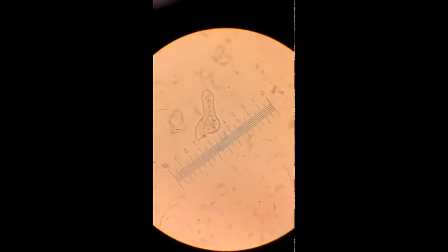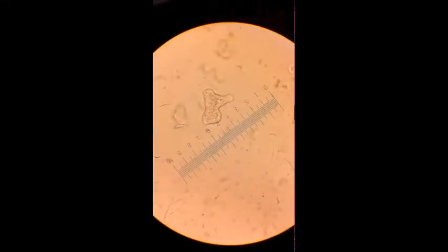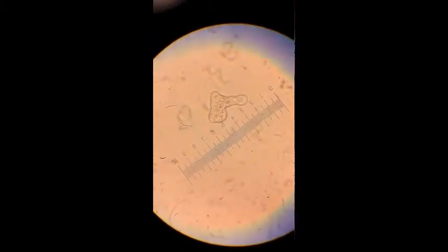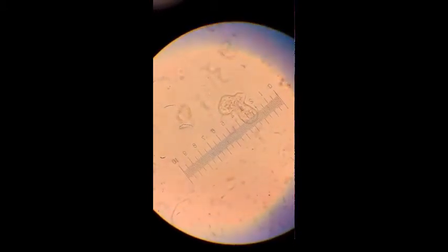This here is an amoeba. It's an incredibly interesting single-celled protist, and you can tell it's an amoeba by its very interesting form of movement. What it's doing here is actually releasing its cytoplasm from its outer membrane and letting it pour out into the environment, which it then moves over and uses like a foot. It's called a pseudopod, meaning false foot, and this is the type of movement that the amoeba adopts.